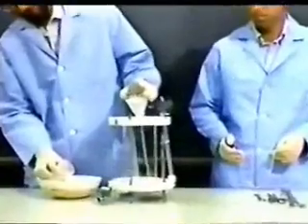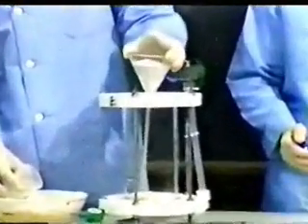So we're as chemically inert as we can possibly be. We selected four soils for our experiments. These soils bracketed a range of permeabilities from 10 to the minus second centimeters per second to 10 to the minus sixth centimeters per second, representative of anything from a coarse, freely draining permeable soil to a more clay-like, less permeable soil. The materials selected included coarse, very clean quartz sand for the higher permeability soils, and fine ground quartz for the low permeability soils.